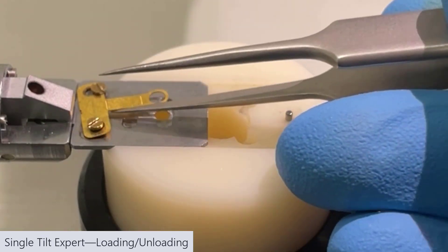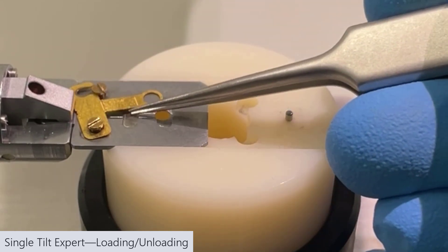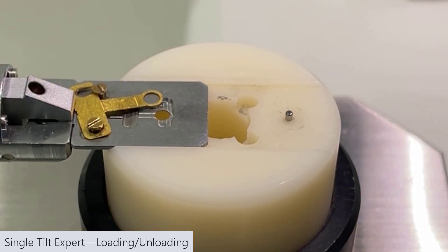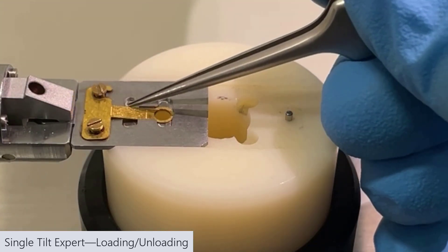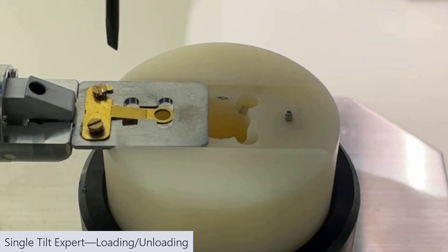I'm stuck here because it's getting stuck on the metal piece at the end there. That's the tricky part because it barely moves out of the way. But then you would load your sample just like I showed before, tighten it, etc.